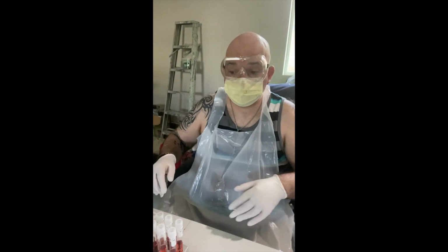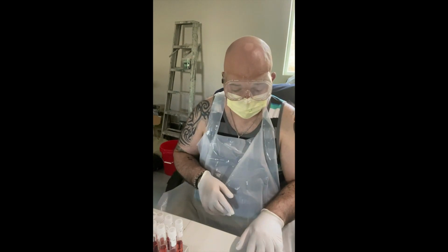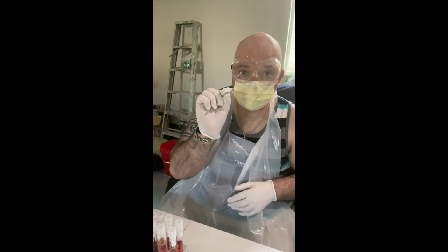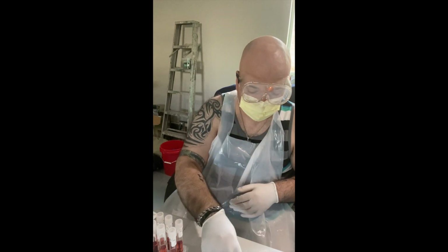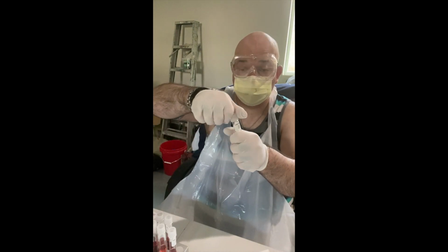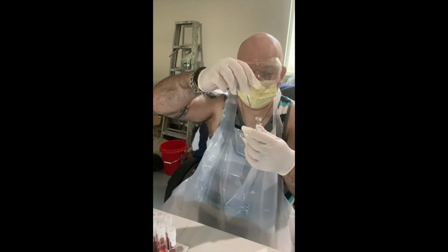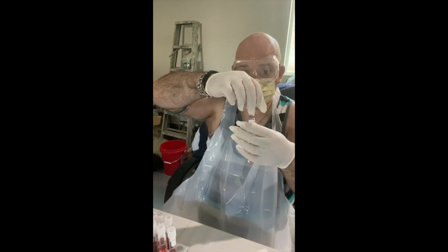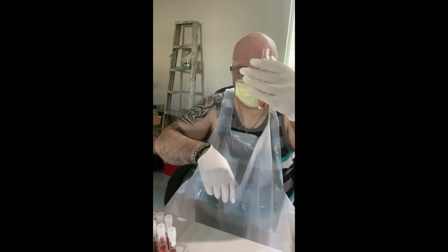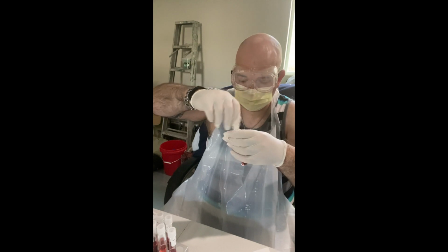Okay. All right, so the next step now is to put a Durham tube, that little test tube looking thing that traps gas if gas is produced by the fermentation reaction. So I've removed all 6 tubes from the alcohol and made sure that they're nice and dry. Make sure all the alcohol is drained. So I'm just going to put one in each tube. They're going to go face down, so the opening of the tube is going to go down into the tube with the rounded bit facing up. Okay, so that looks about right. I don't see any air trapped in the tube. So there's one.